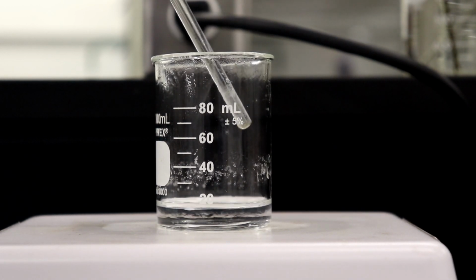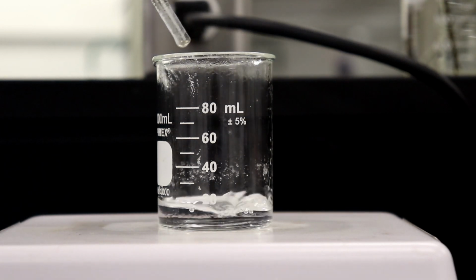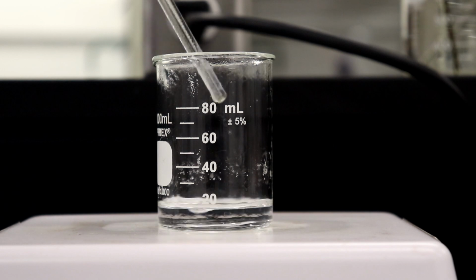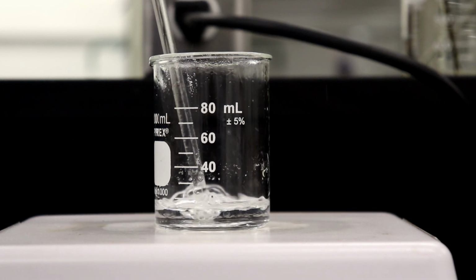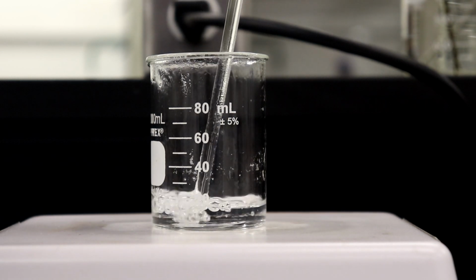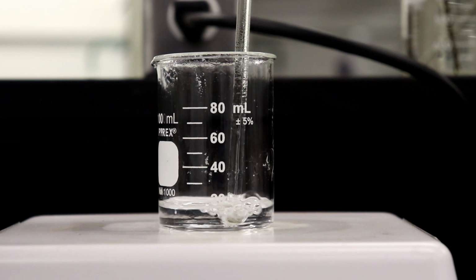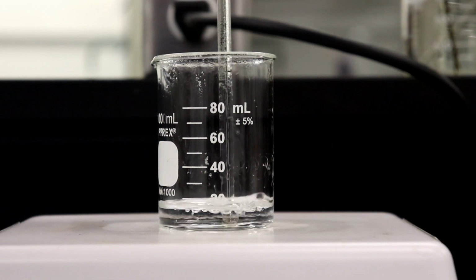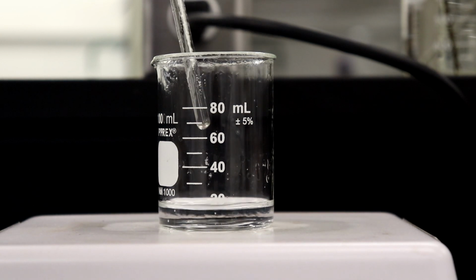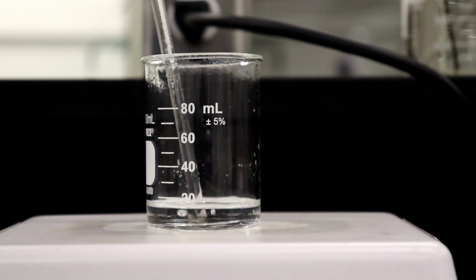If you're ever doing crystallization, air and crystals need a point to crystallize off of. So if you're just at the cusp of crystallization and you drag a glass stir bar across the bottom, you're basically scratching all the glass surface and giving the water an area to boil out of. So I take it out, not a lot of bubbles, put it in, more bubbles. If I scratch it, lots of bubbles.